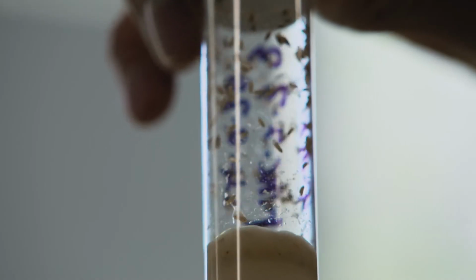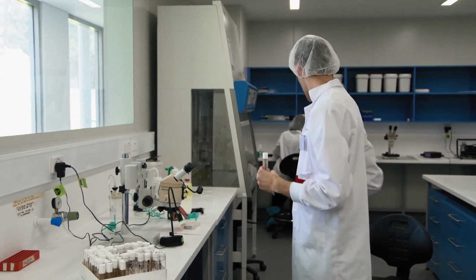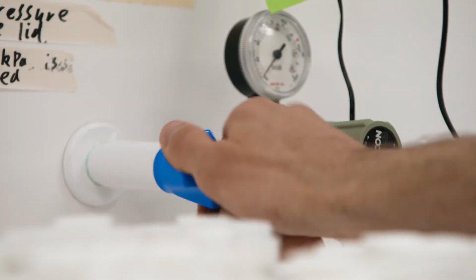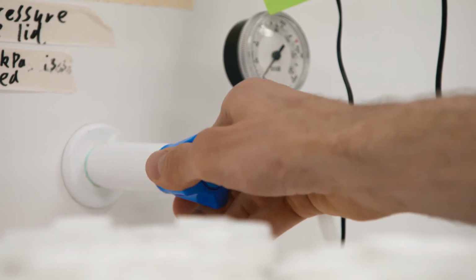And what happens is then the DNA that you inject ends up being incorporated into the DNA of that fruit fly. The reason we chose fruit flies is because they're very easy to genetically manipulate and they have a very fast life cycle. And so the idea is essentially to use the fruit flies as a platform to prototype how this technology would work in mosquitoes or in fish or other types of animals. This is essentially a platform technology that enables a lot of other breakthroughs.